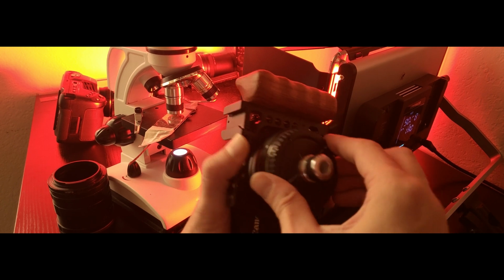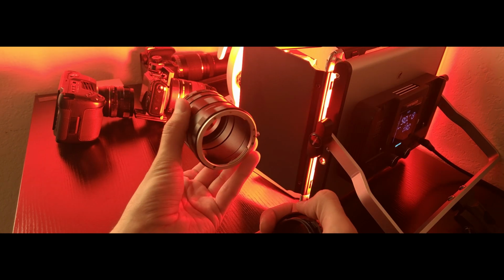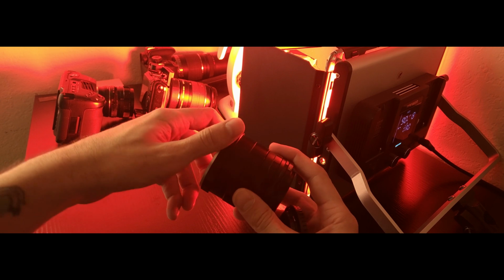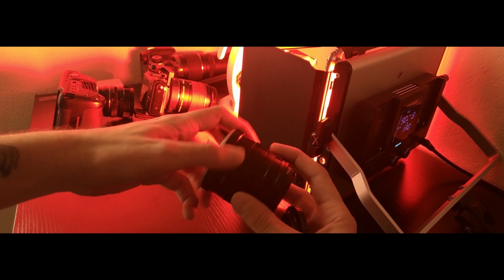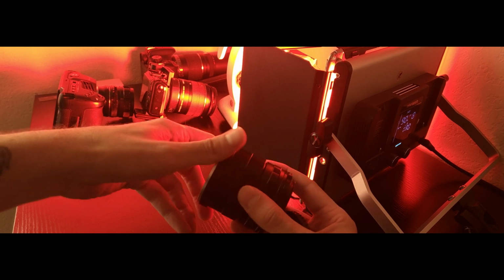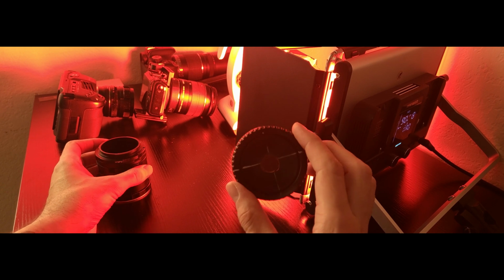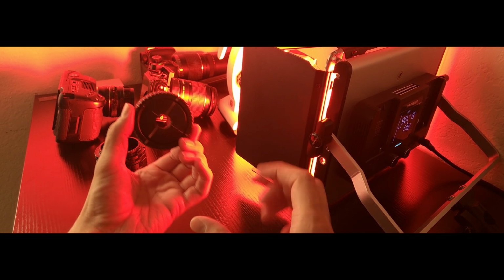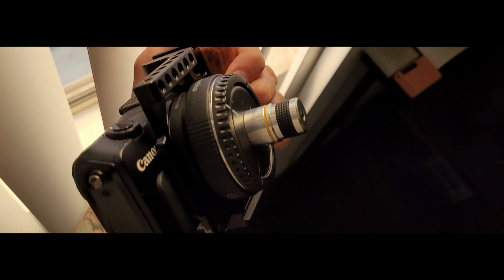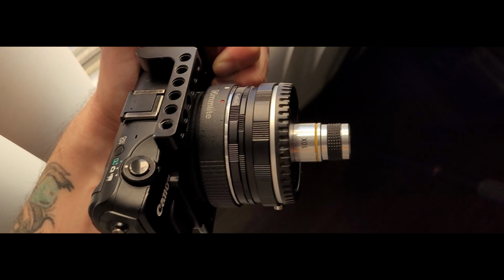You can also use these three pieces of tube called macro extension tubes. They go between your camera and your lens for increasing the distance to get more macro shots. I can extend this magnification by increasing or decreasing the distance without changing the microscope lens. Easy to carry around at a botanical garden or on a natural hike, like carrying a portable microscope with you.